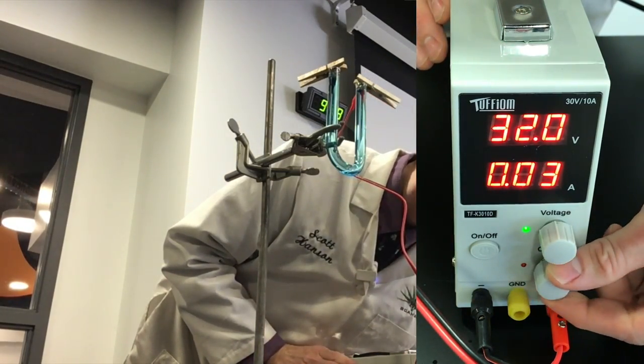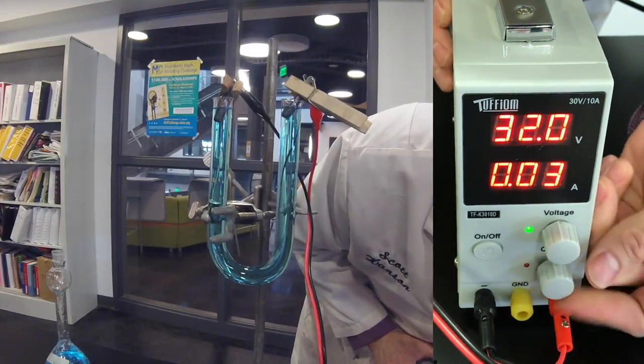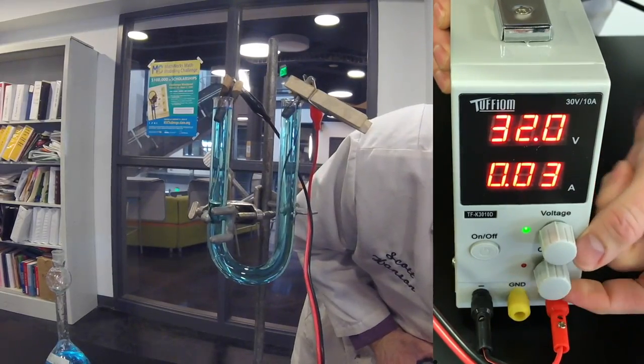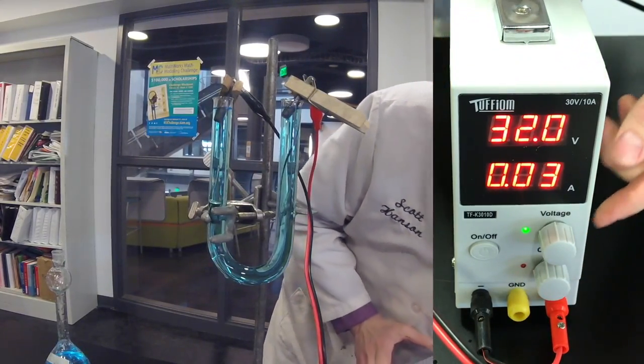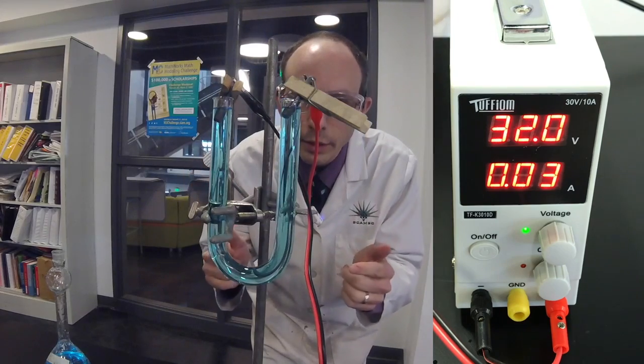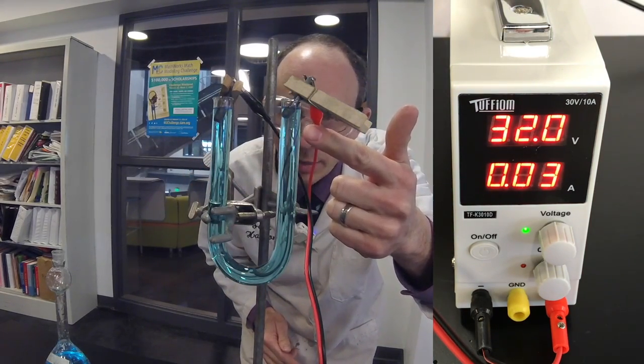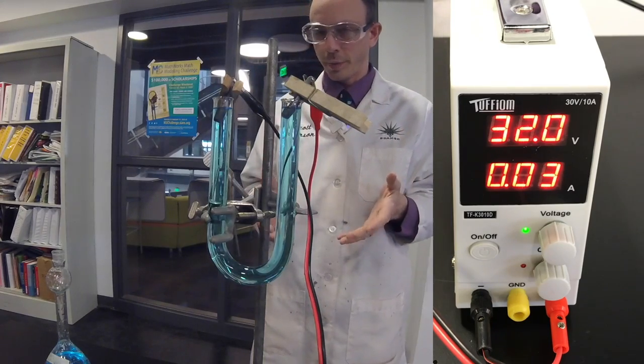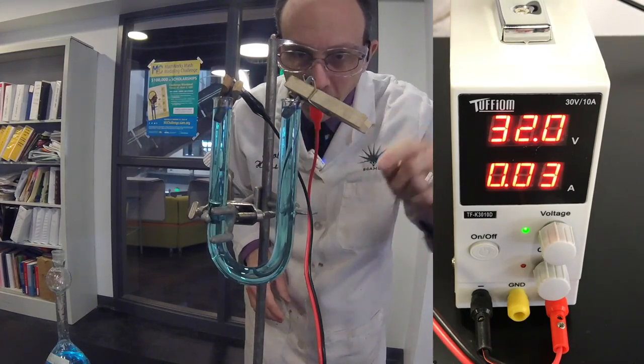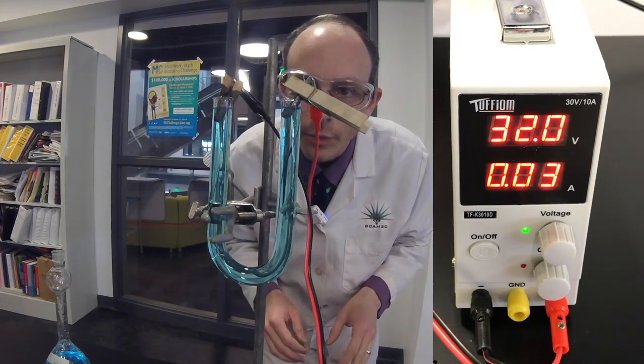And we're going to roll. And what we notice happening here is there are some bubbles that are forming right here on this red side.